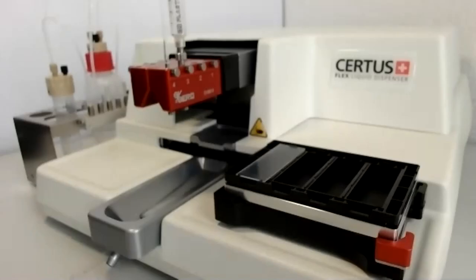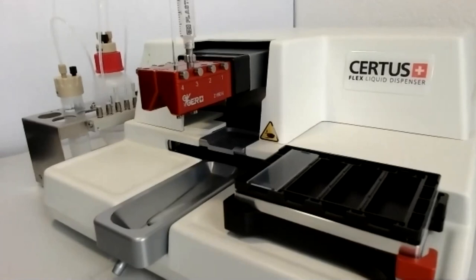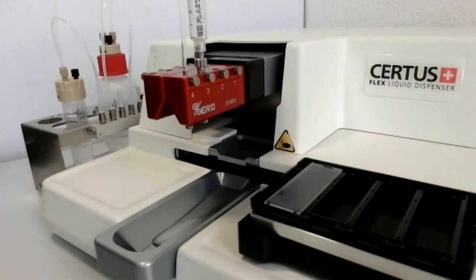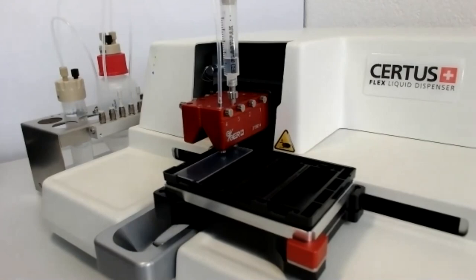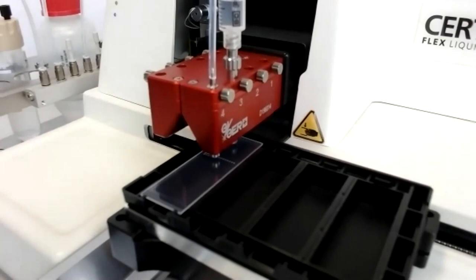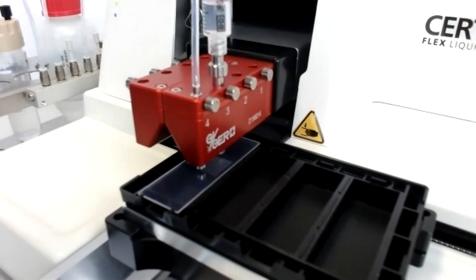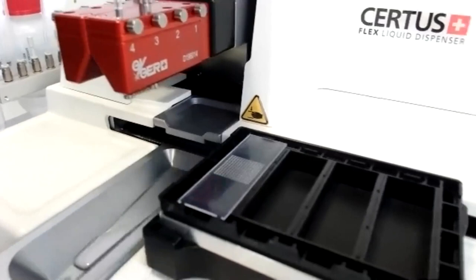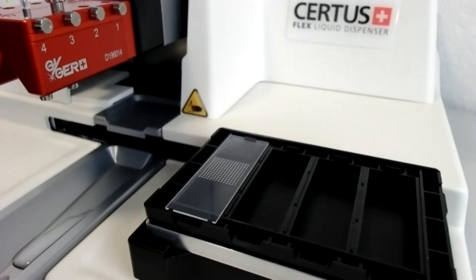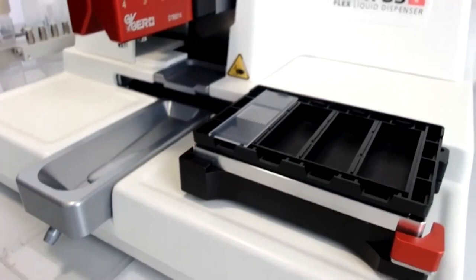Now, I'd like to show you how the CertusFlex is performing to dispense onto those microarrays. Therefore, I'm going to switch to the closer webcam. I hope you are able to see the droplets shooting out of the valves. The system is now dispensing 50 nanoliters from channel 3 and 150 from channel 4 at the same time. And, of course, you could configure more than four channels at the same time to do more complex protocols.